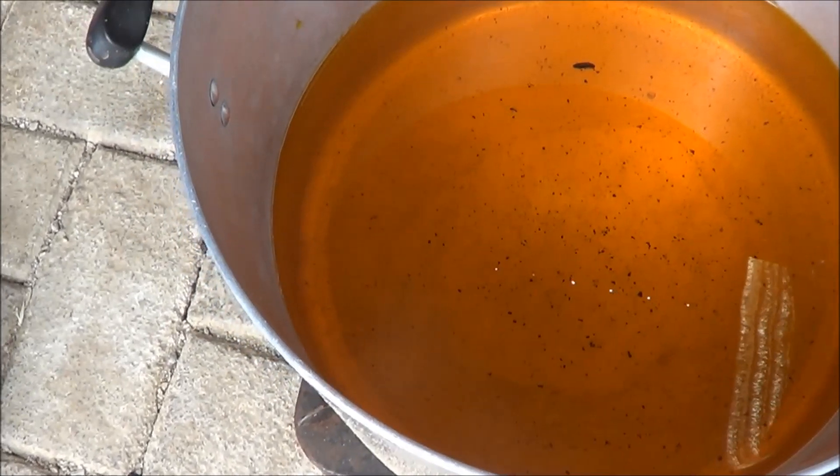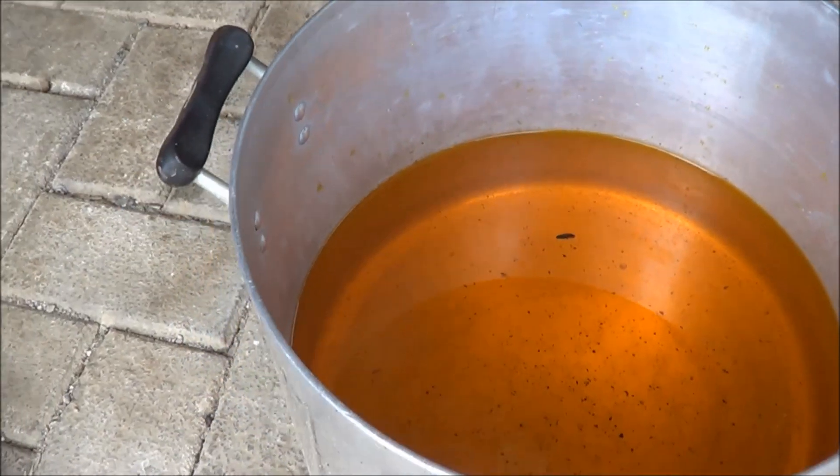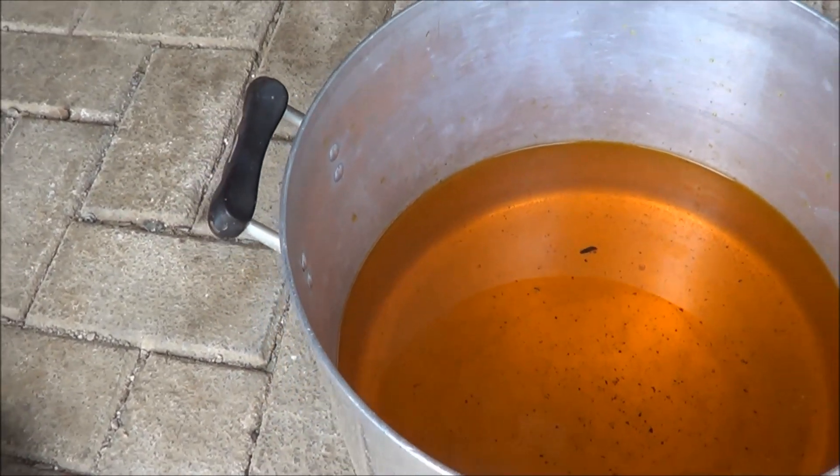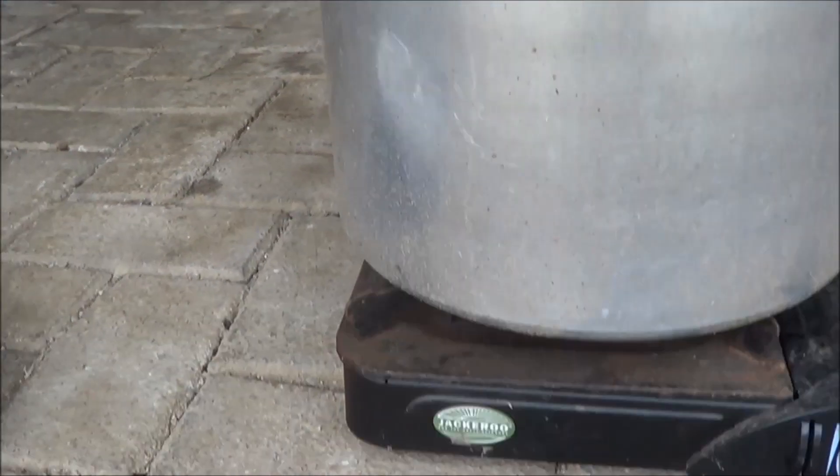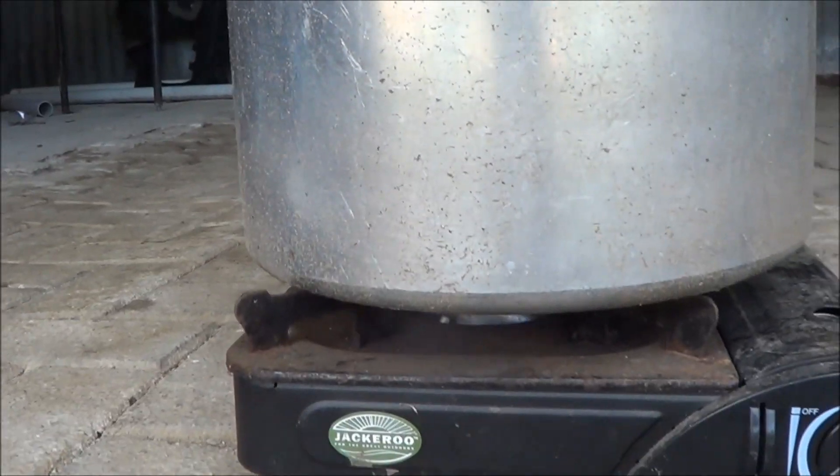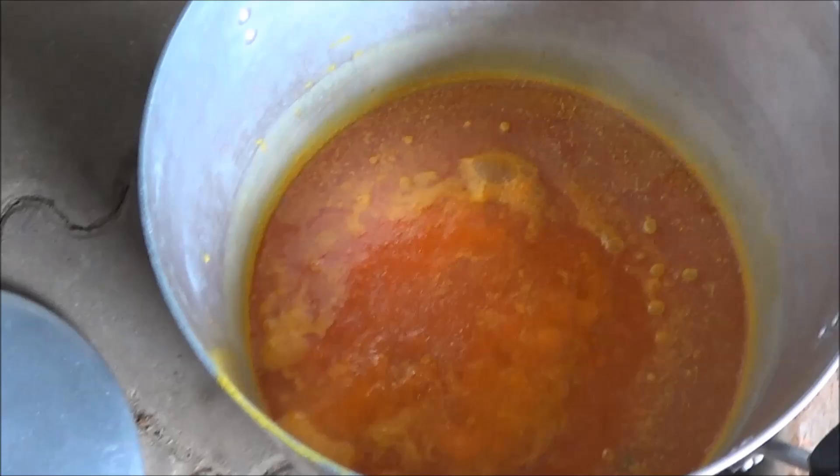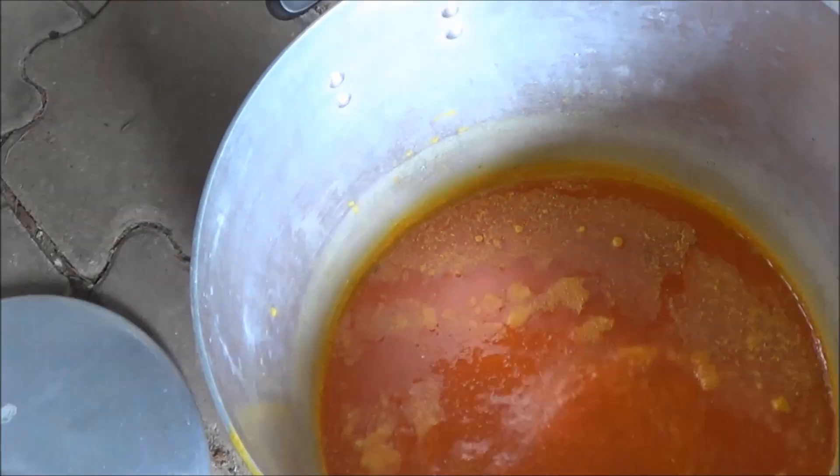So here I have the final chromate mixture, it's got a small bug in it, but yes, it's got a few liters so I'm going to have to boil it down. It's going to take quite a while as well, I'll use up quite a bit of my gas, but that's okay, gas is cheap. You can see here it's nearly boiled down to form crystals.